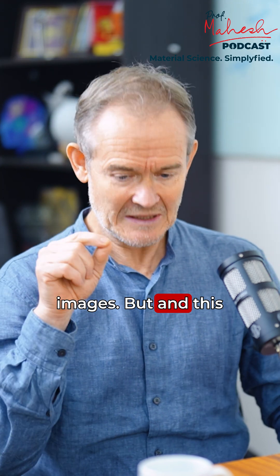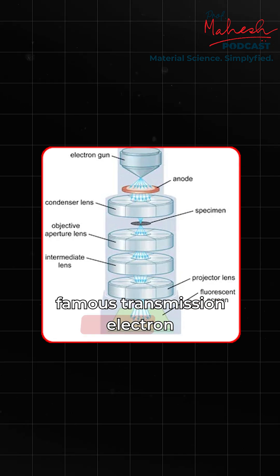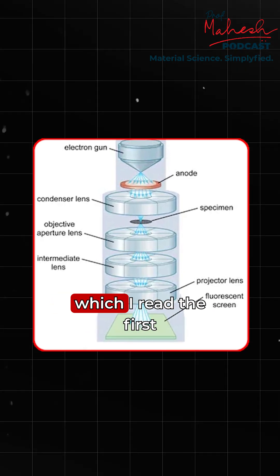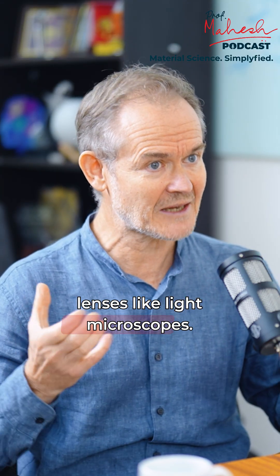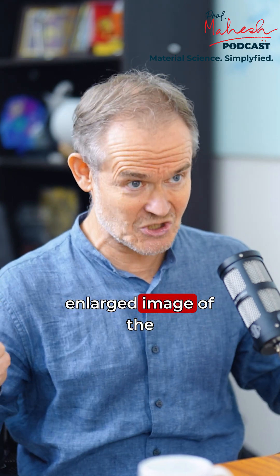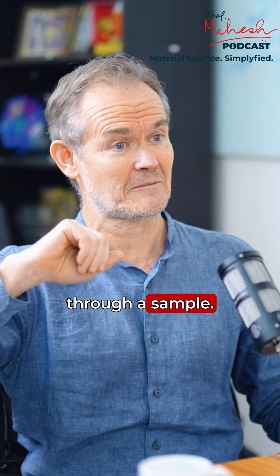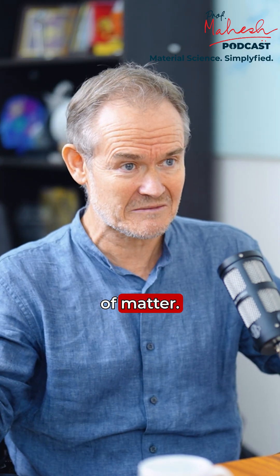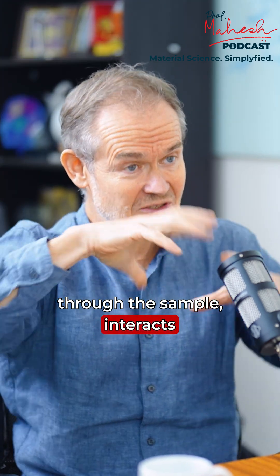It is important to distinguish: the famous transmission electron microscope, which many people know, works with lenses like light microscopes. These lenses create an enlarged image of the electron wave which travels through a sample. You have a very thin sample of whatever kind of matter, and an electron wave — like a light wave — travels through this sample and interacts with it.